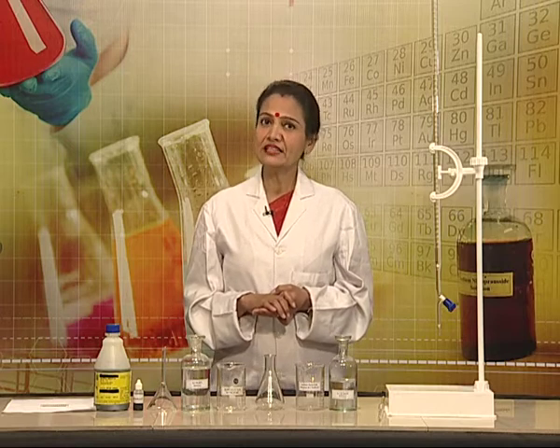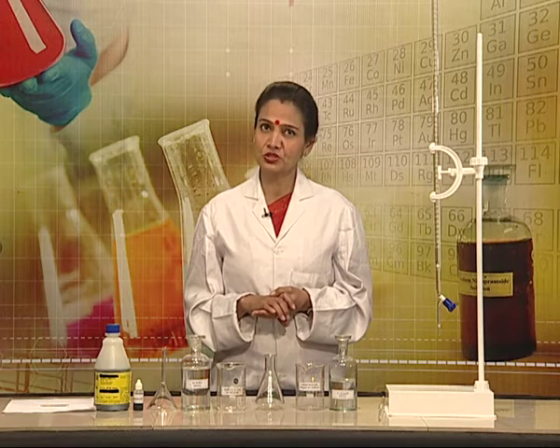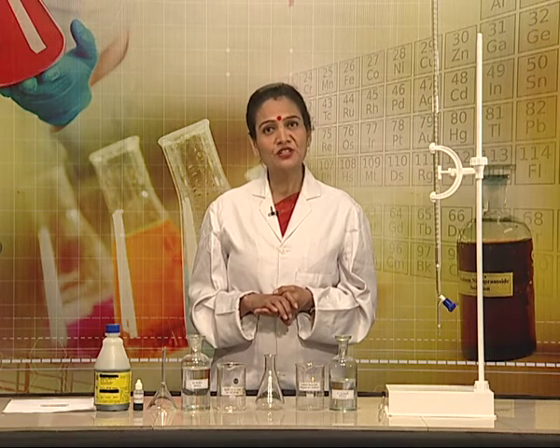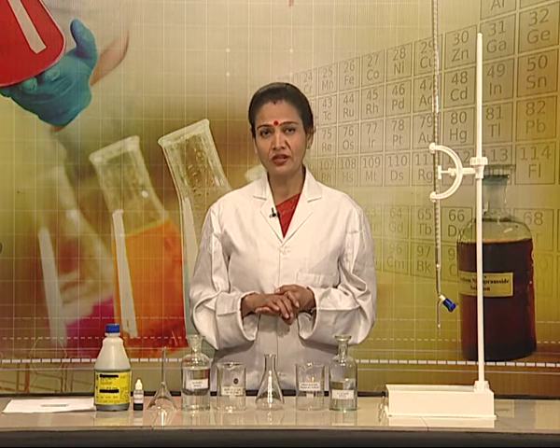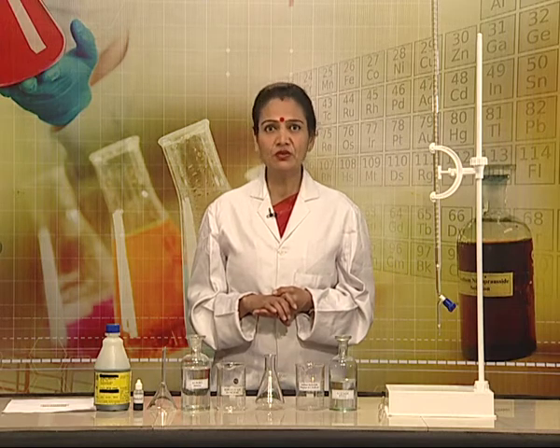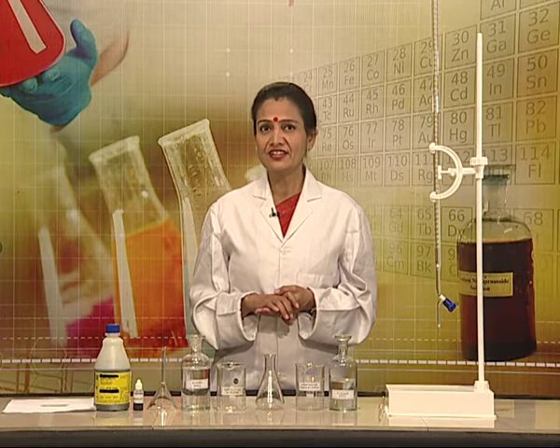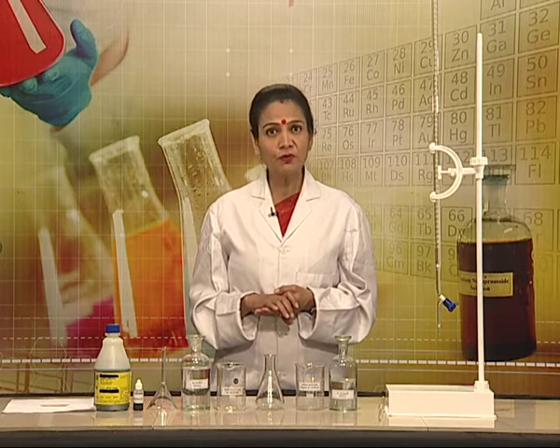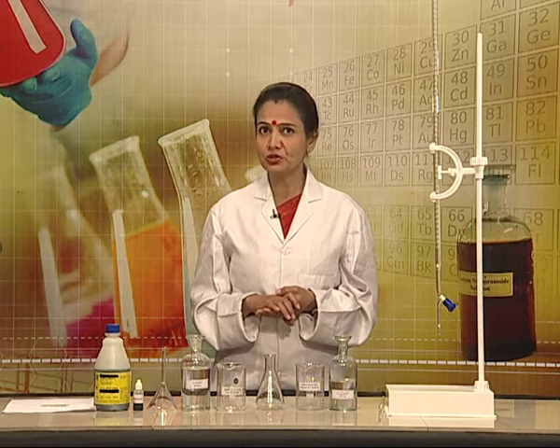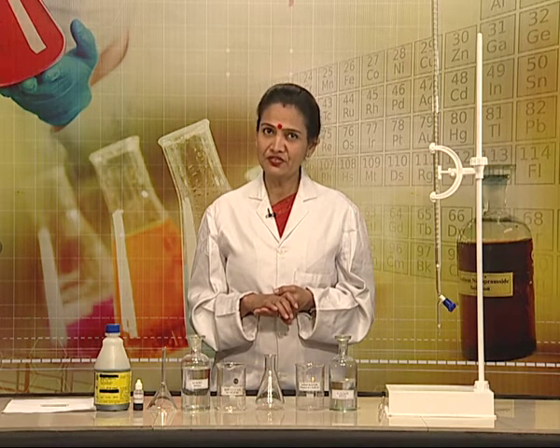We know that in titrimetric analysis, we determine concentration of solutions through volume measurements. That means a solution of known concentration, which is called the standard solution or titrant, is treated with a solution of unknown concentration. The process of adding a solution from a burette to the other solution taken in a conical flask is called titration.